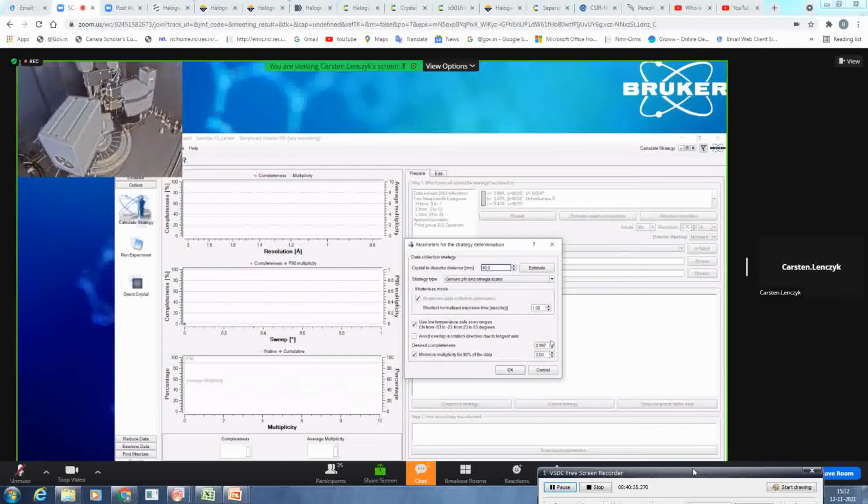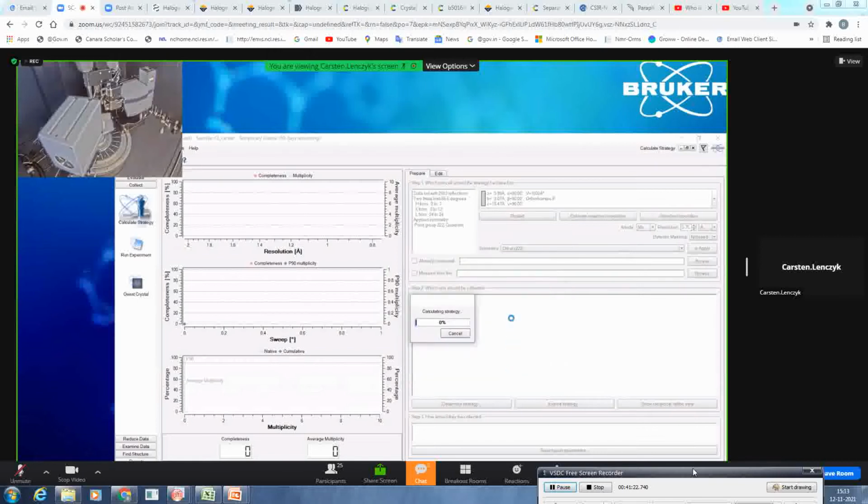You can fiddle around with the overall completeness you want to have. You can also adjust the minimum multiplicity you want for 90% of your overall data. So you can say, okay, please collect at least so much that I have a multiplicity of 3 for the 90%. If you have one large unit cell length, you can also check this one. It will then take into account that it will not do the rotation direction with the longest axis, so that you don't provoke overlaps. So you can check it here if you have a super long unit cell length present. So you click on OK. It will calculate. What it does now is go back and forth asking the hardware and the instrument, okay, I would do this run.